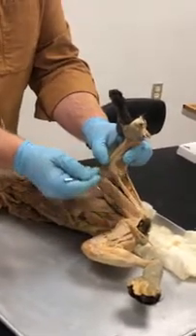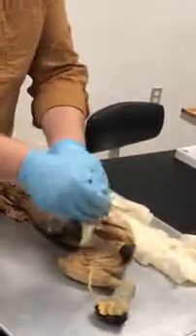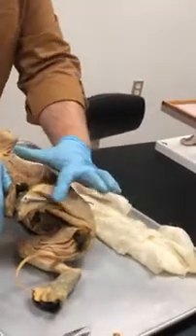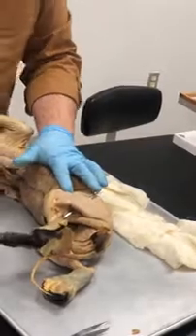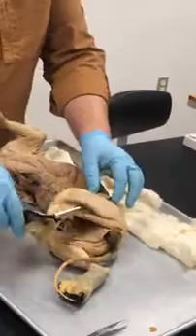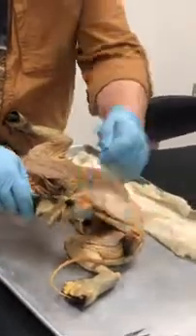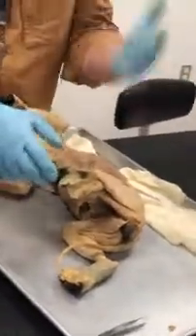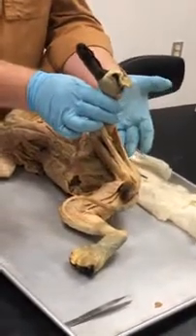Now look at this. When you look at this view, it looks like this. But what happens here, when you look at this lateral view, this is the biceps femoris. It's huge on a cat. That's why cats have adapted to run faster than humans, because of a muscle like this. Okay? So if I point to this, you guys say biceps femoris. So you've got to look at it. That's why pictures are okay, but when you have a video or you have the actual cat in front of you, it becomes three-dimensional. And that makes it a little bit more conducive for you.